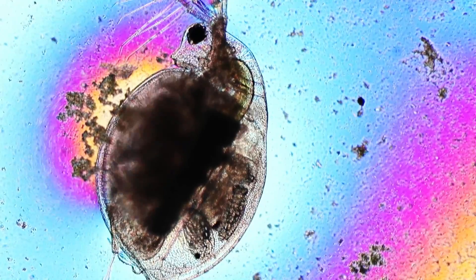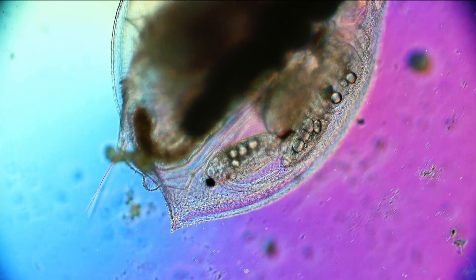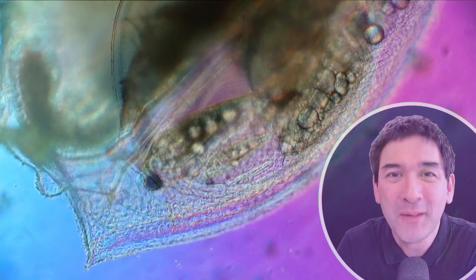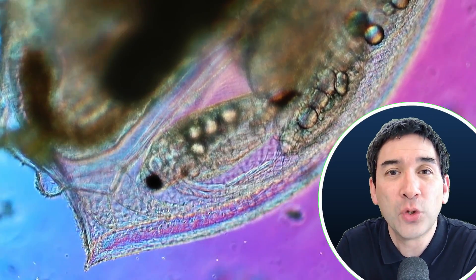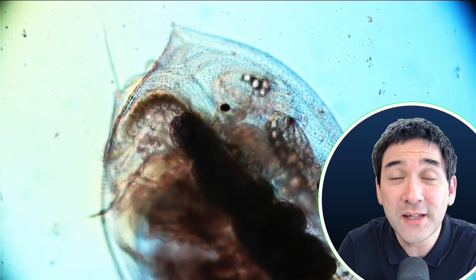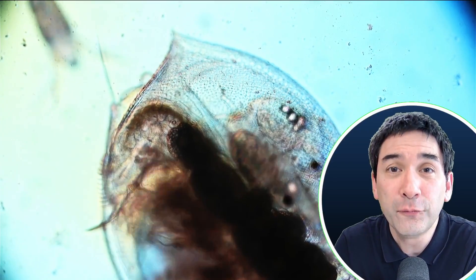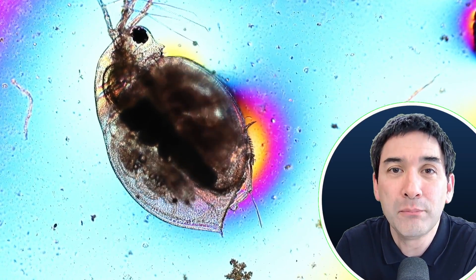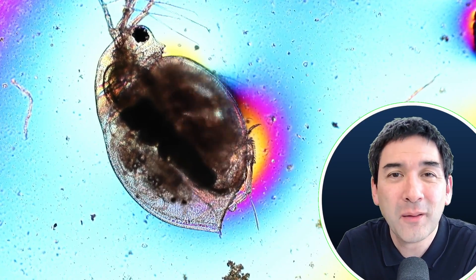The water flea reproduces both through parthenogenesis and also through fertilized egg cells. Here's a little bit of biology I need to explain. Parthenogenesis is when the babies develop out of so-called unfertilized egg cells. Normally egg cells are fertilized, however in this case the water fleas are able to reproduce out of unfertilized egg cells. Those egg cells develop in the so-called brood chamber of the water flea, located in the back of the water flea.